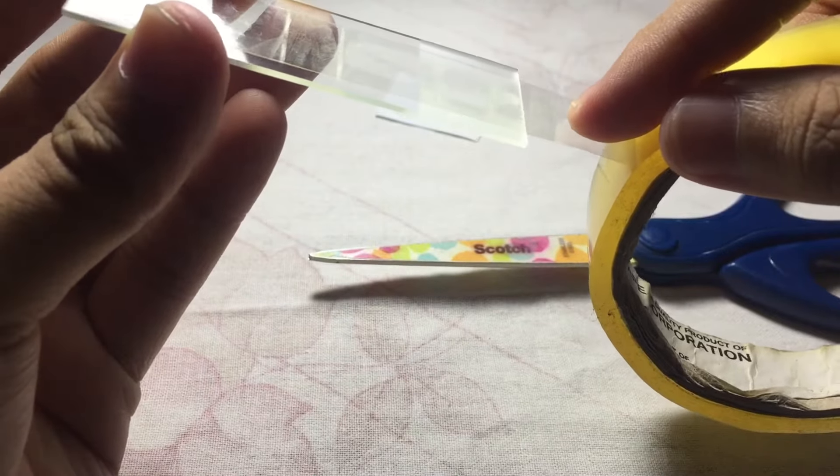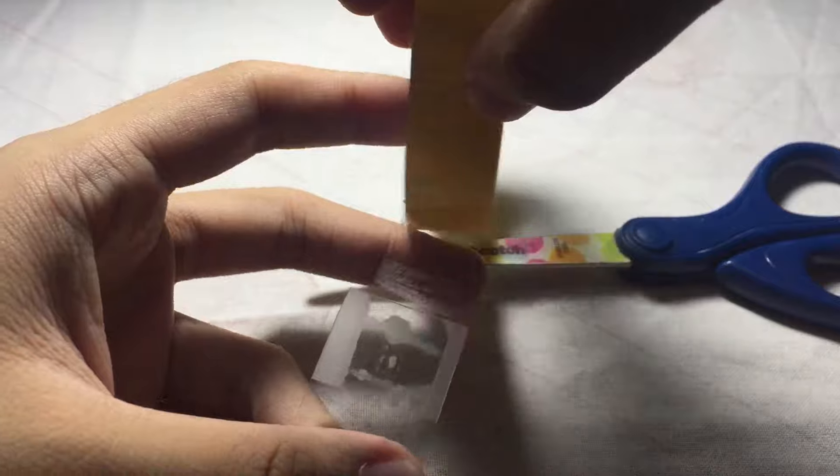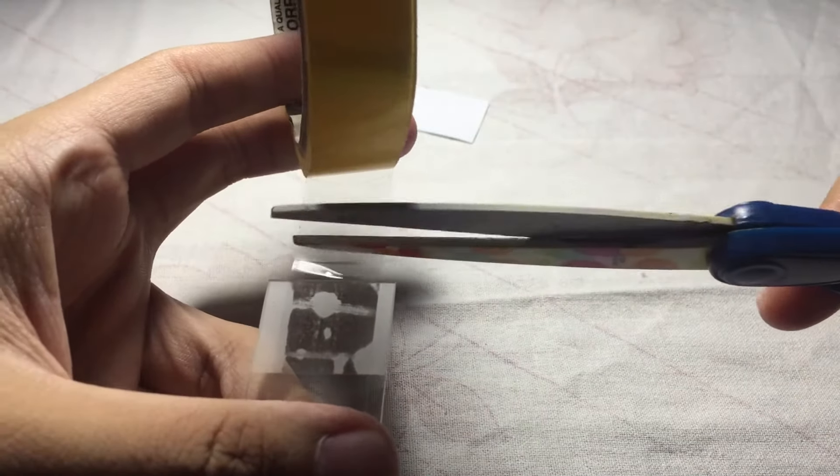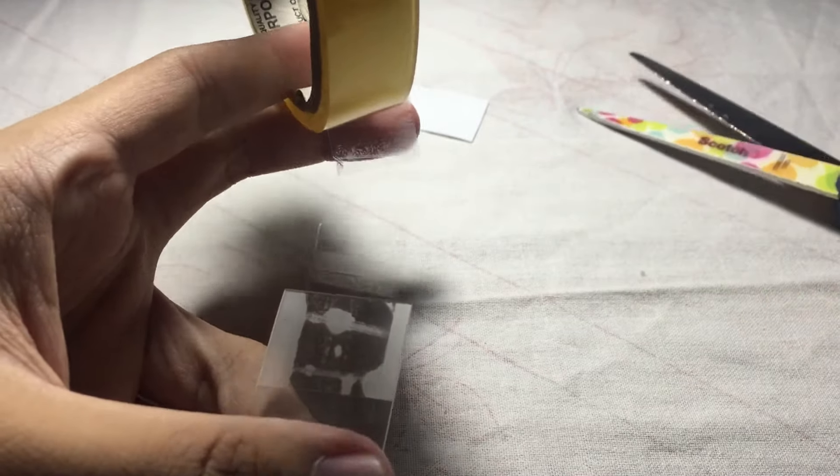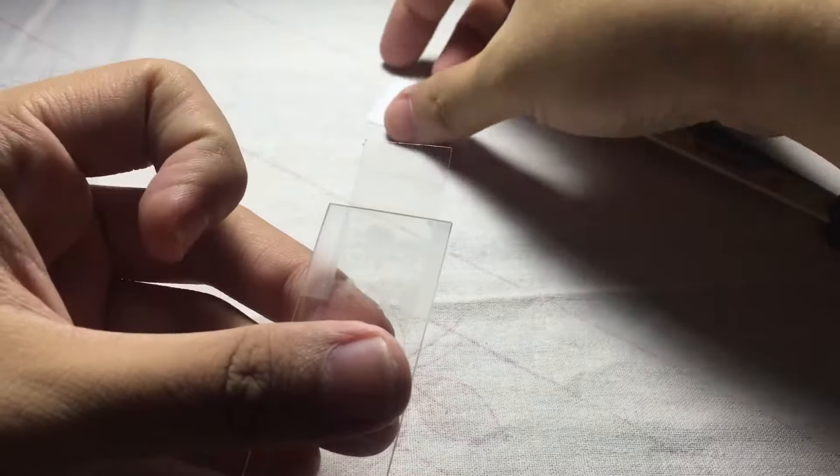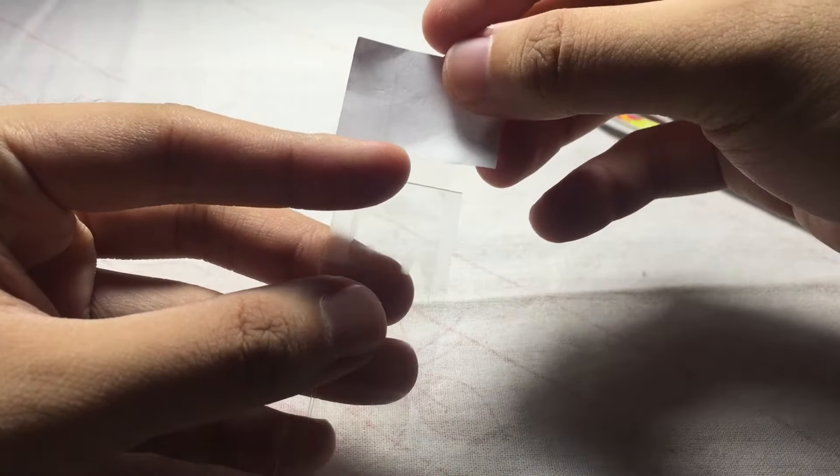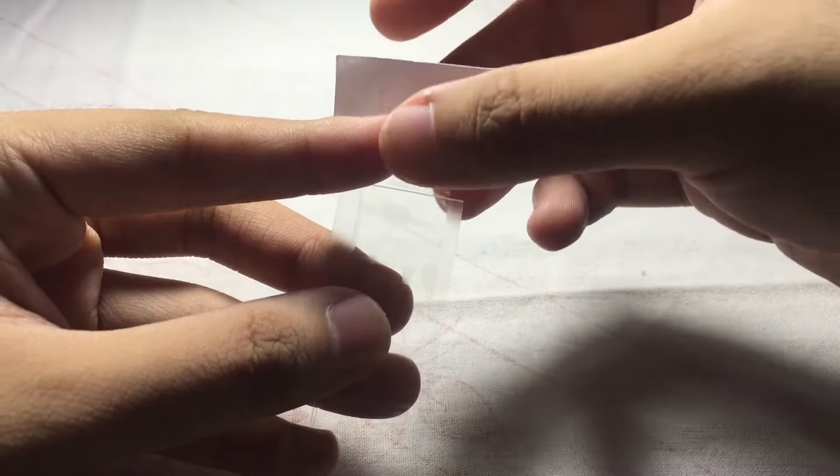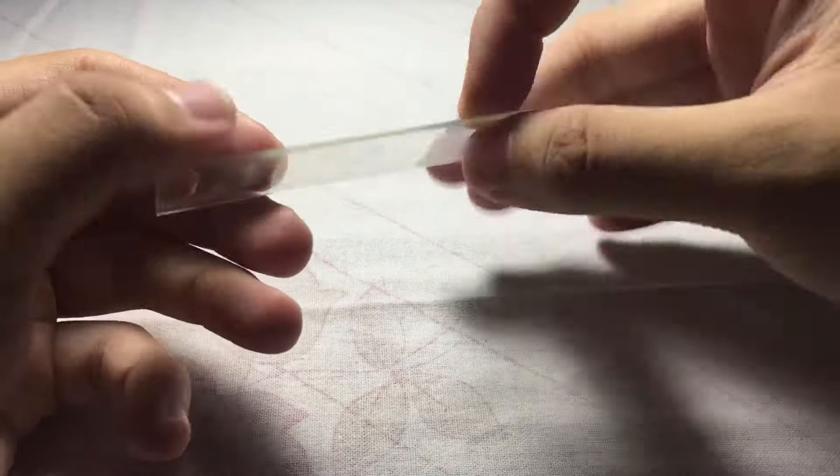Before cutting, you leave a small area of freed tape. Then we attach your paper which will serve as your label. So this is now your scotch tape swab - this is the front and this is the back.